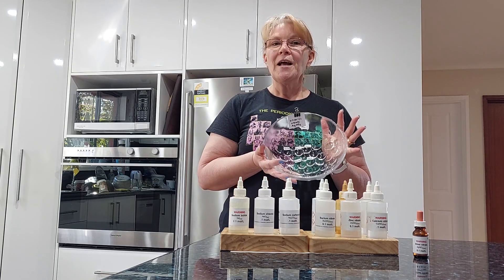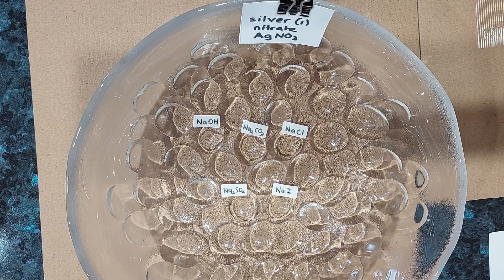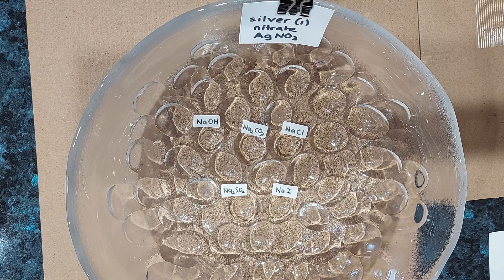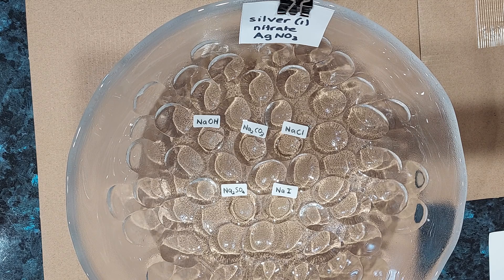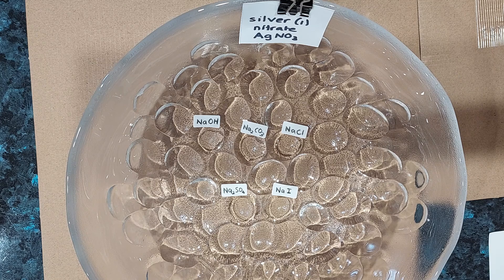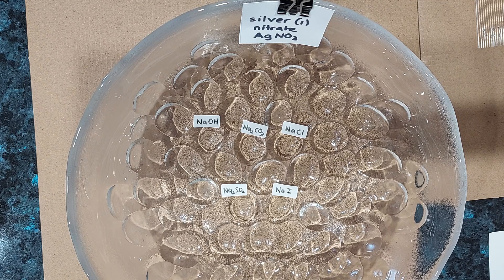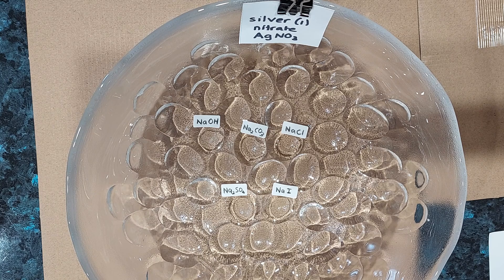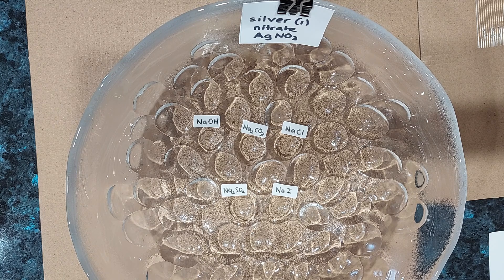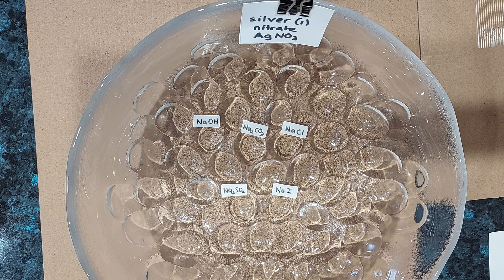So let's get on with the experiment. I've put three drops of each of these sodium salts into the dimples in my spotting tile, and the first nitrate I am going to try with them is silver nitrate. I'm going to add just a few drops of silver nitrate to each of these. Let's have a look at what happens.